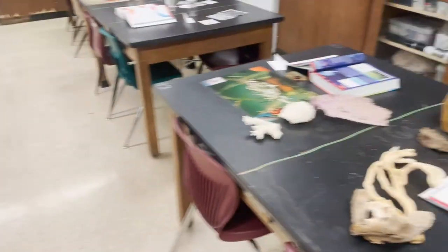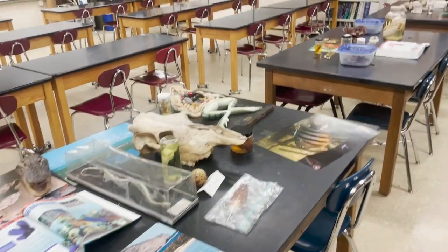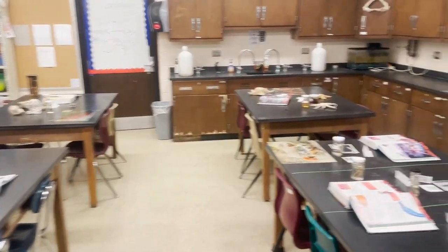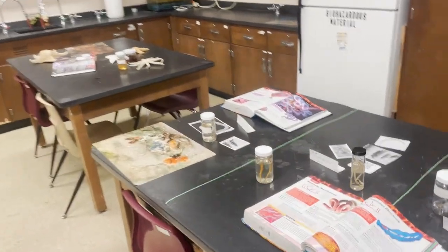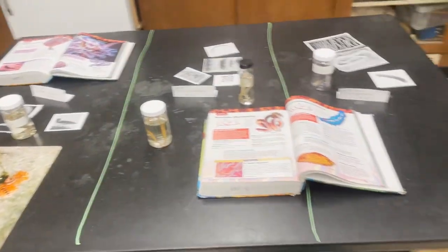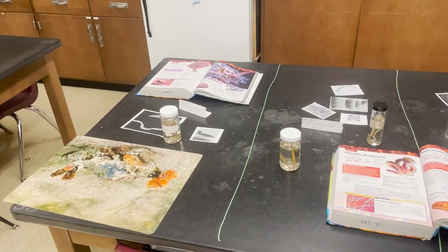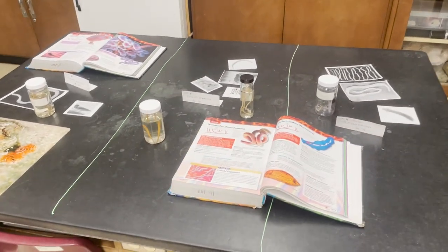Here we are. As you can see there are nine animal phyla but we only have six tables. So on some of the tables, like right here, this is the worm table. You'll notice that we have one, two, three different phyla of worms.